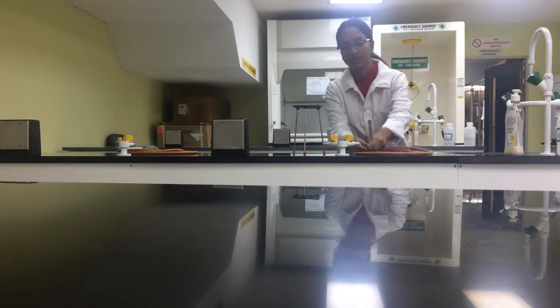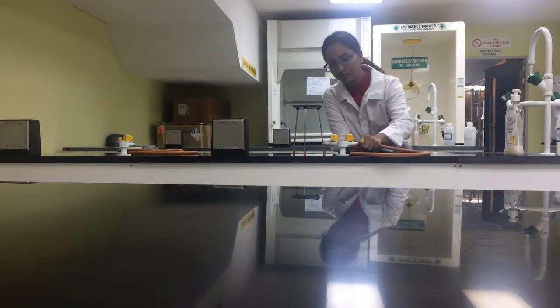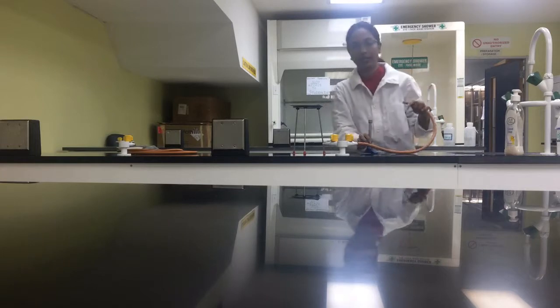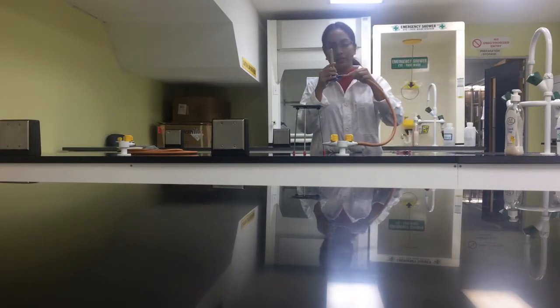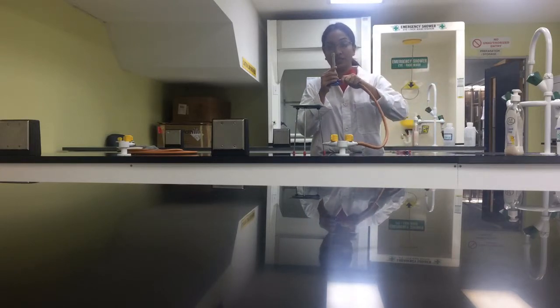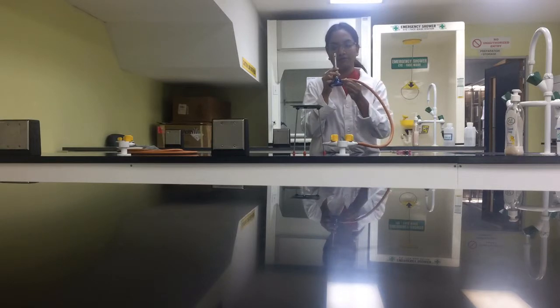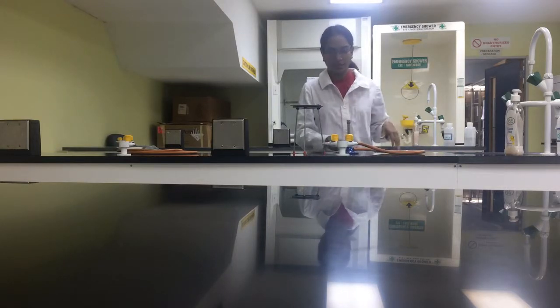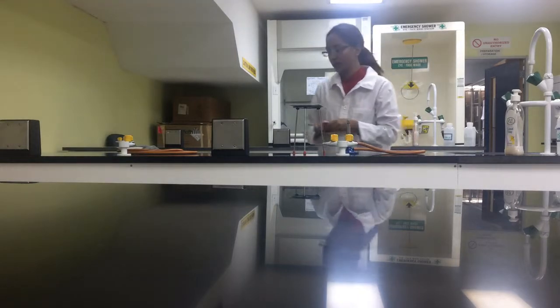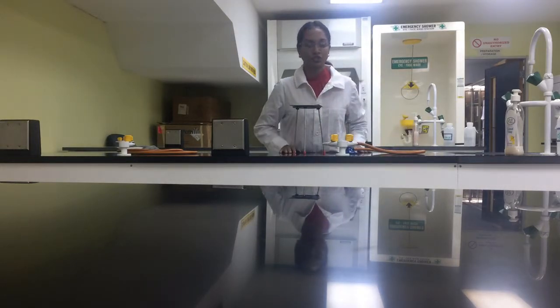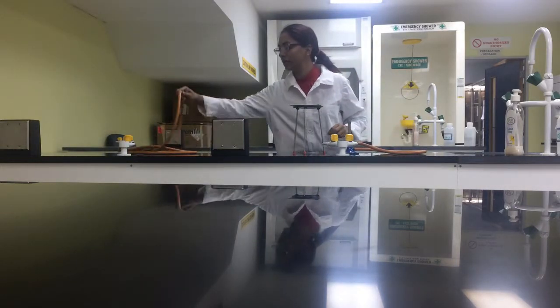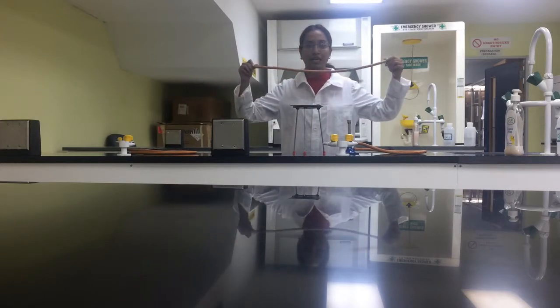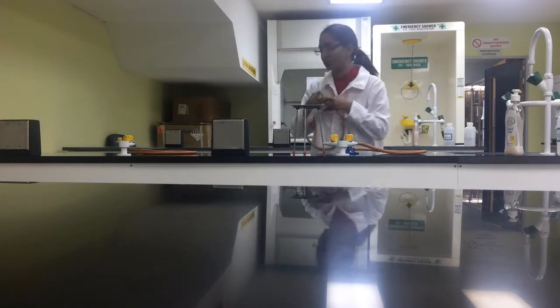Basically, I'm going to connect it to one end by the gas and then one end in the Bunsen burner. Make sure it's secured carefully, there's no air spaces for gas to exit. Also, you want to make sure that the hose isn't too long and dangling, so you can cut it to suit.